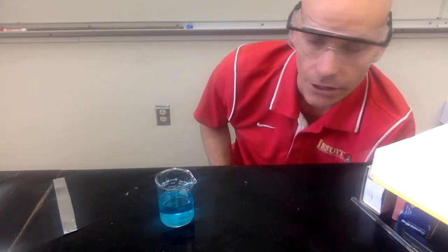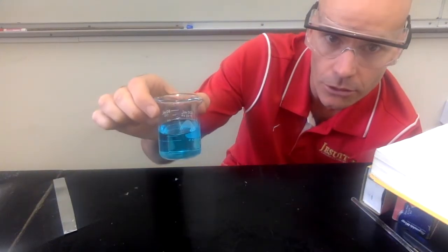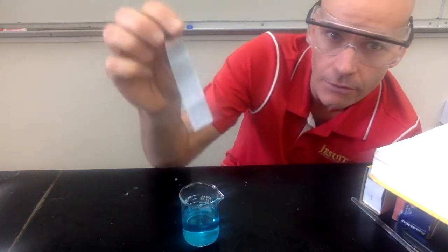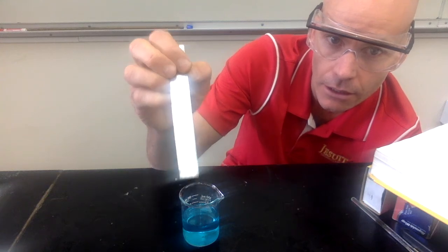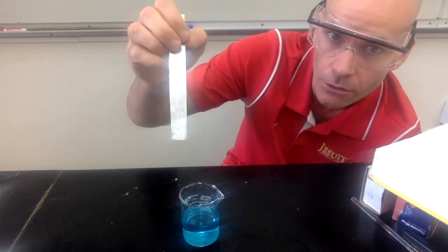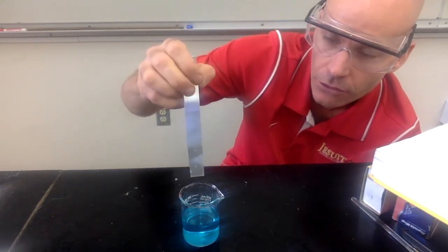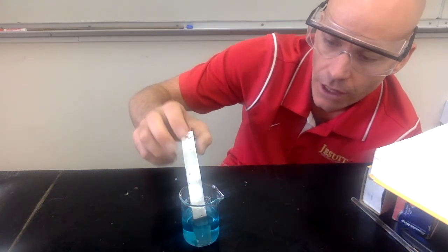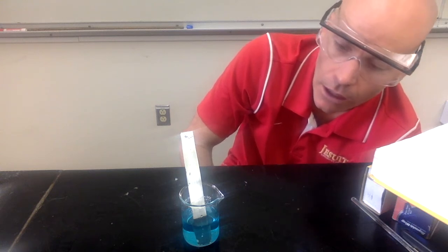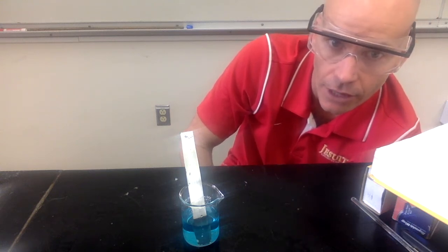This is investigation 13. So I've got a blue solution right here. And I have a piece of iron metal right here. We're going to put the iron into the blue solution. Make sure you make observations on the metal and the solution first. Then I'll place it in there, and we'll leave it in there for a couple minutes. And you make observations as it's in there, and then after I take it back out.